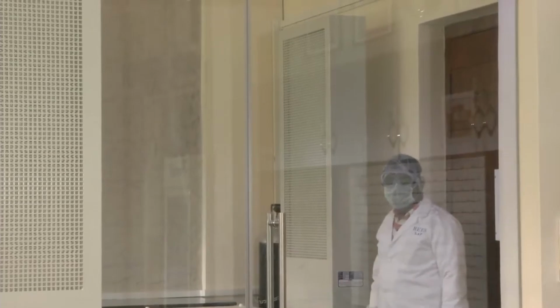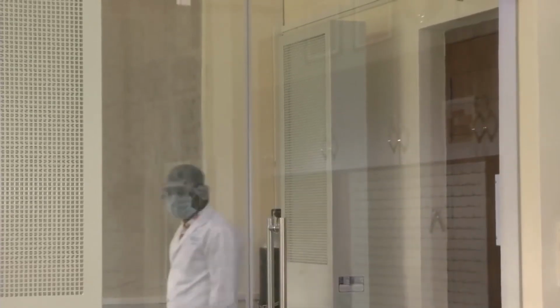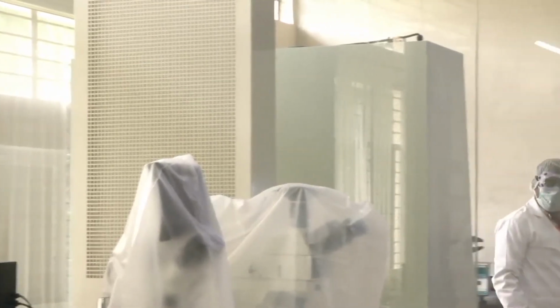Apart from this, there is another positive pressure module. Sitaram is moving towards the positive pressure module. He will point you to that positive pressure module. You can see his gloves. So that is a positive pressure module. It is like an air conditioned system, but in a much grander way.